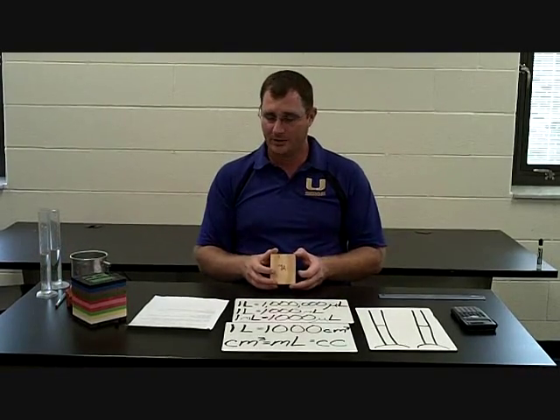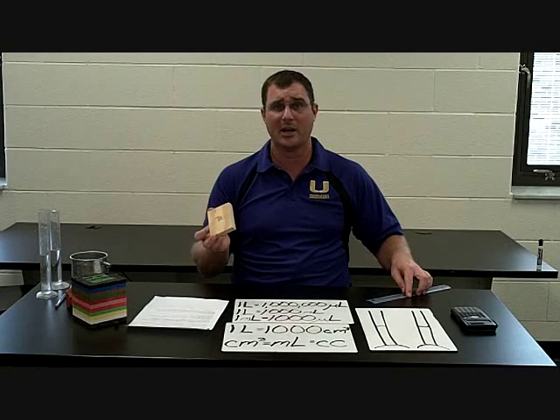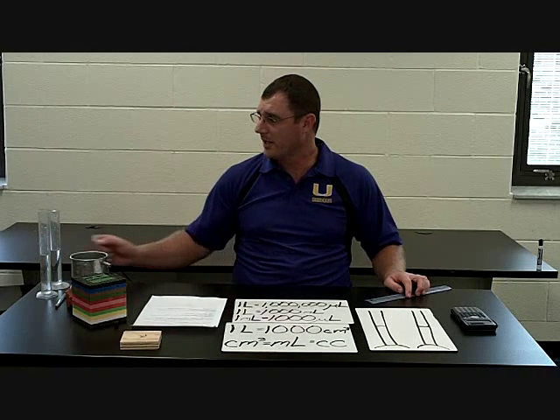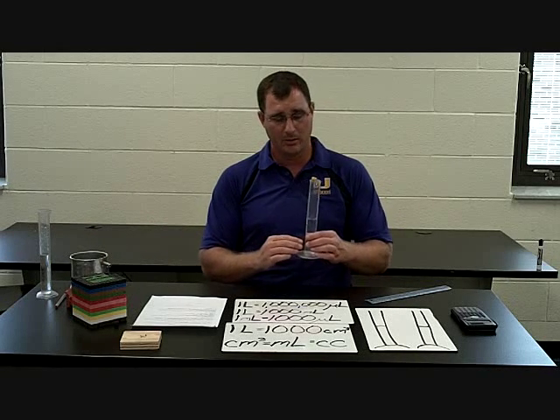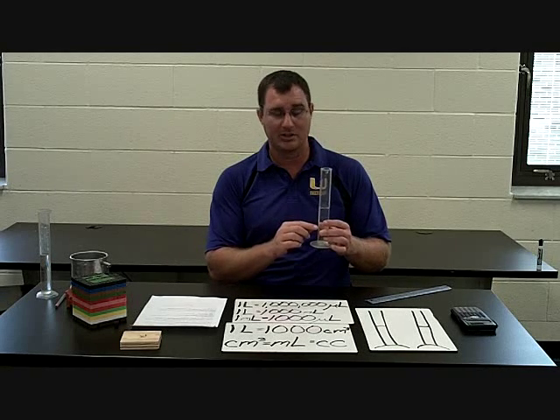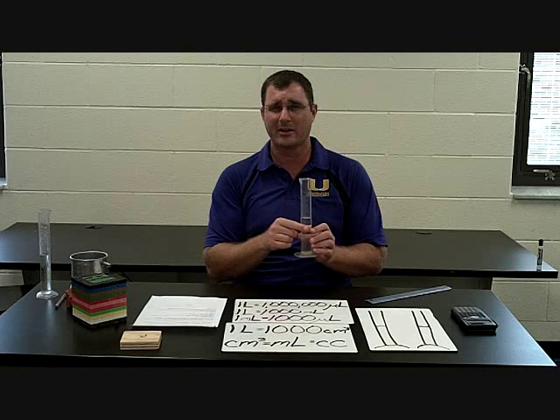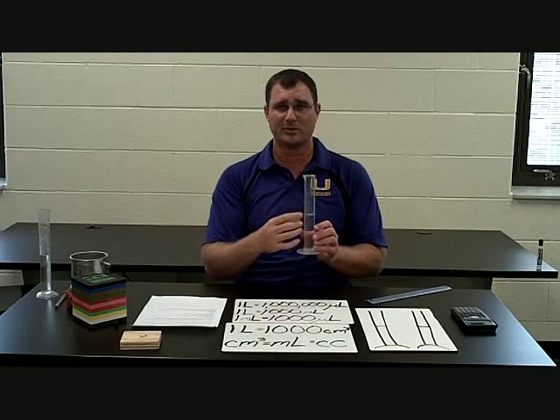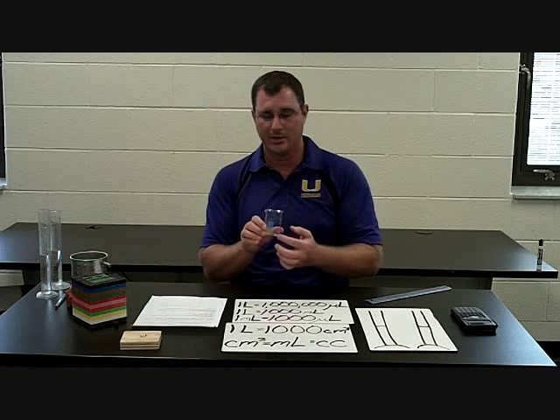As far as measuring: if we're measuring a regularly shaped object, probably the easiest way to get the volume is to simply take a ruler and go length times width times height. If we're measuring a small, irregularly shaped item, the easiest way to do that is with water displacement. We're going to put it in a graduated cylinder and see how much the water increases. You have to make sure there's enough water so it covers the object but doesn't overflow. And it's a lot more accurate to use a graduated cylinder than a beaker — graduated cylinders force the water more up, they have a smaller surface area, so you get better delineation, whereas a beaker has a much bigger surface area and is not nearly as precise.